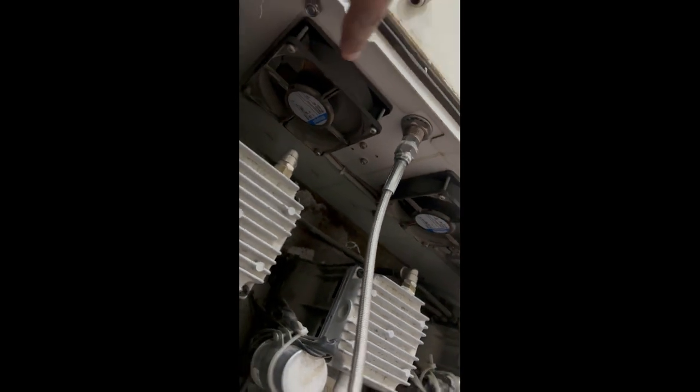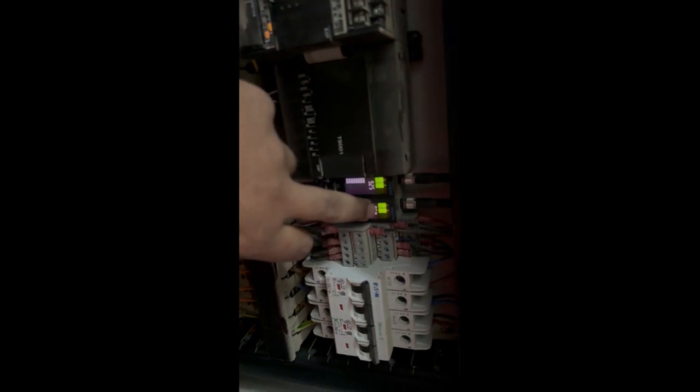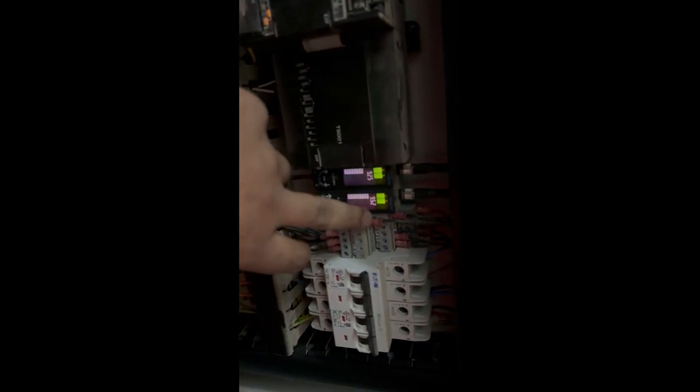These things, and this is not the only coil. Here we have another coil inside this cabinet. The coil from this line goes to this line. So there's the inlet line and outlet, and here we also have some more. Here you can see. And now you can see both pressures have been reached here, and that's why the compressor has switched off.